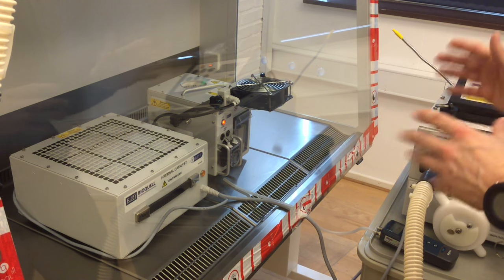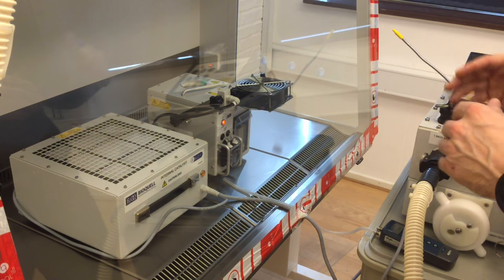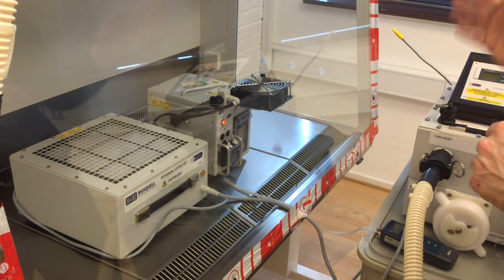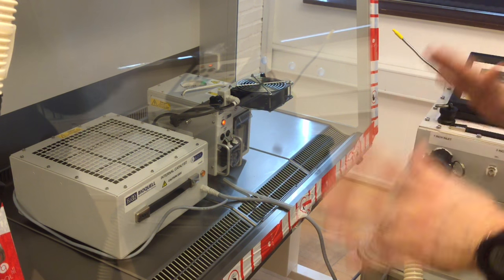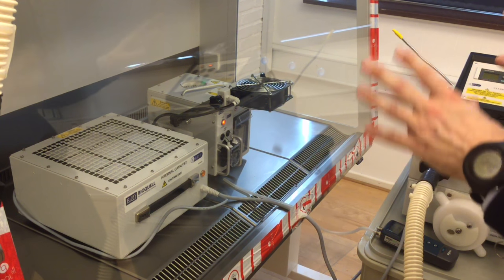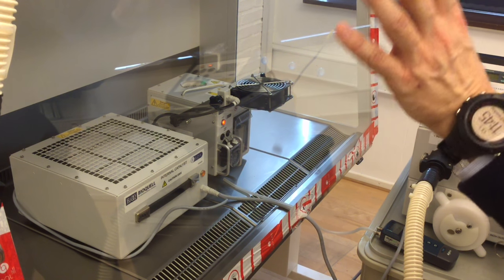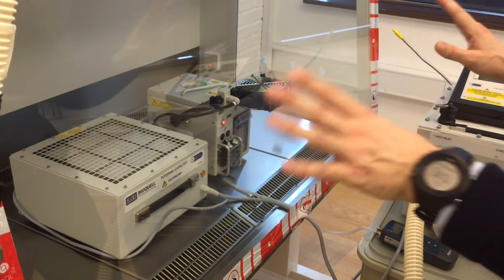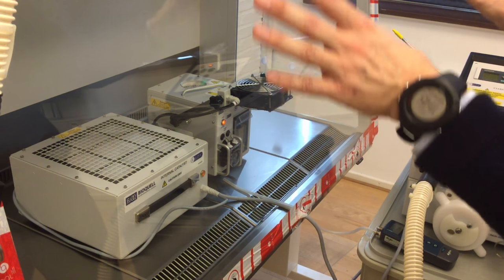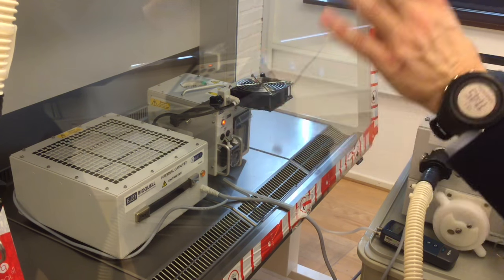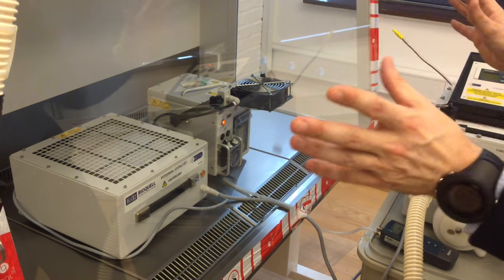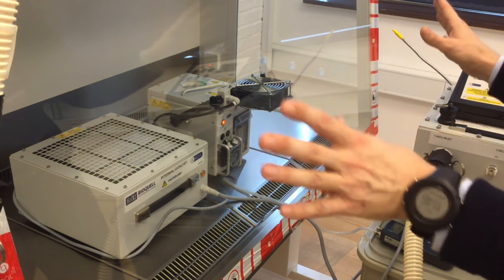And if we can see that the level of H2O2 is below 1 ppm, everything is safe, then we can power down the instruments. We can remove the tape and take away all the equipment and then we have a clean or decontaminated class 2 bench ready for filter change or ready for new work or whatever is needed.